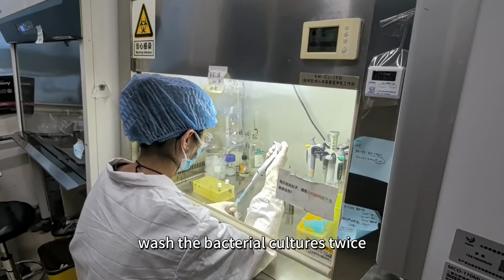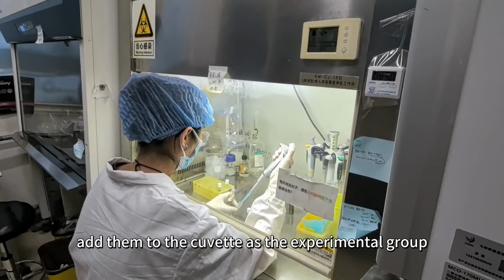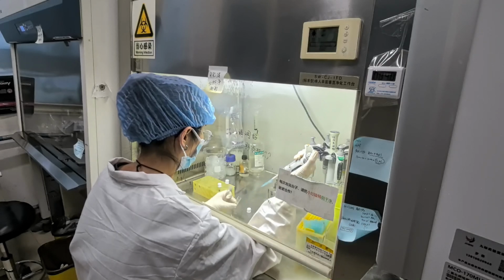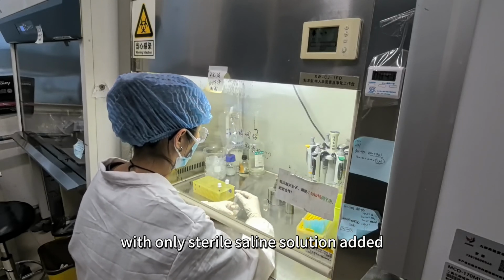Next, wash the bacterial cultures twice with sterile saline solution. After resuspending, add them to the cuvette as an experimental group. Simultaneously, set up a control group with only sterile saline solution added.